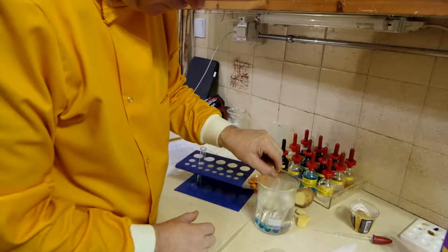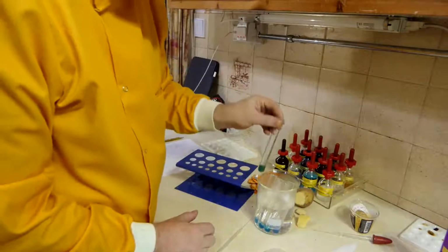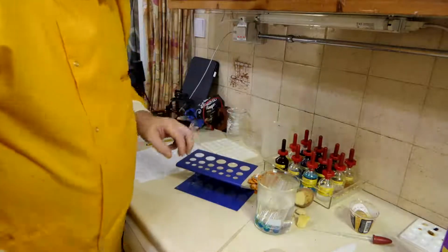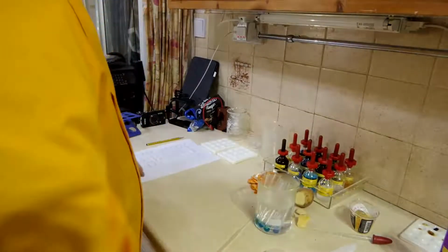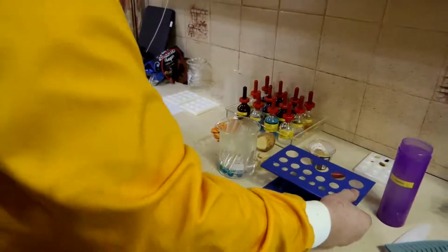And finally, a Satsuma. I'm not guaranteeing how well a Satsuma will work, but there we are. And what we have to do with this is leave it for a few minutes to work. Already I can see some things are happening.